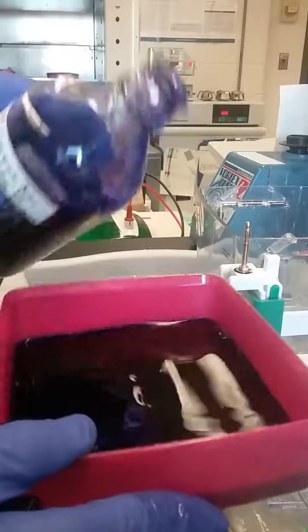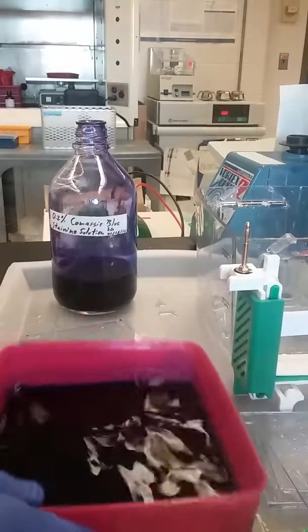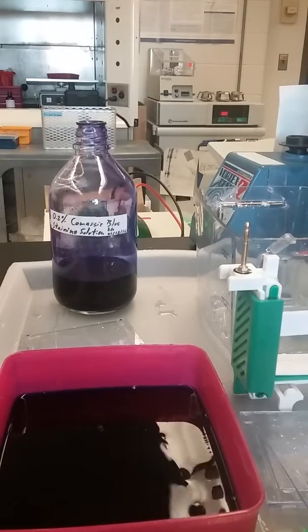Let that stain for a few hours or even overnight and de-stain it, and we'll have protein bands. That's all there is to it.